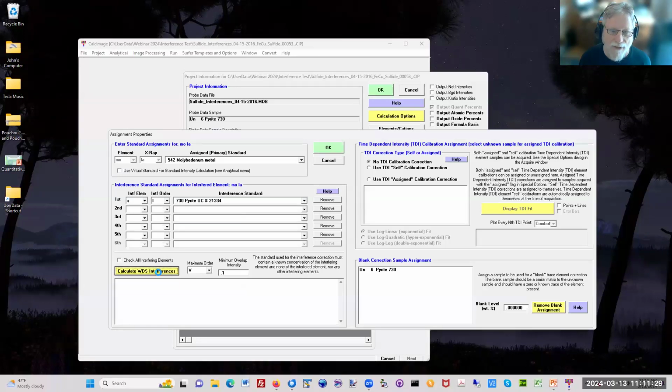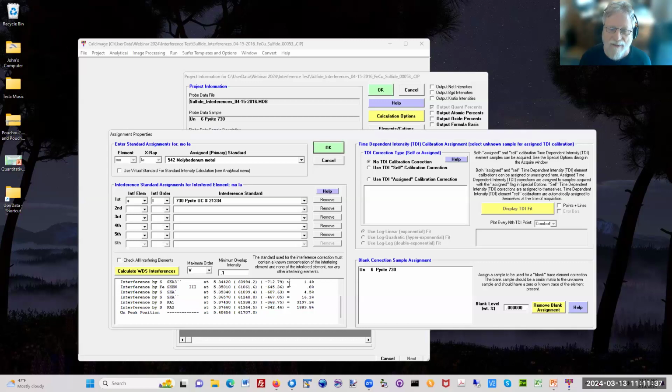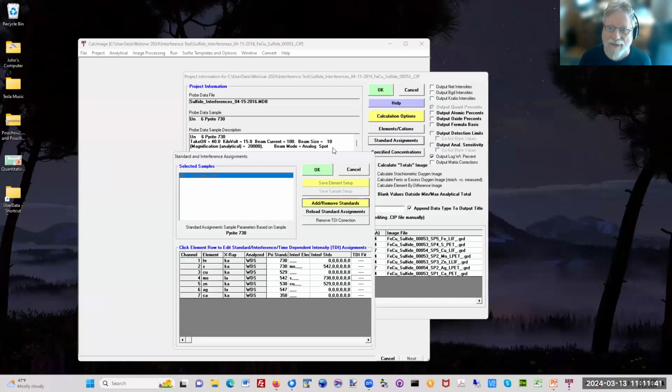And you can actually model this here. You can actually see that sulfur, yes, is a big interference correction for molybdenum. And we can assign that. And now you see the molybdenum here, actually it works both ways. The sulfur is interfering with molybdenum, but molybdenum also interferes with sulfur.